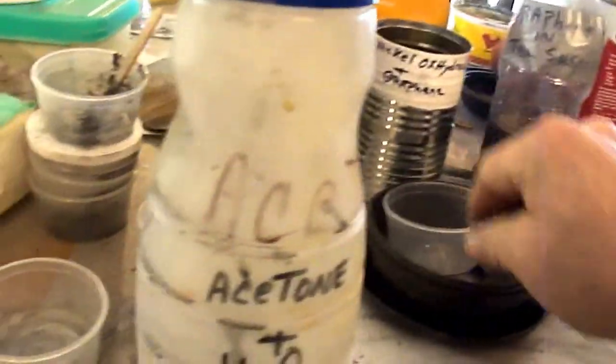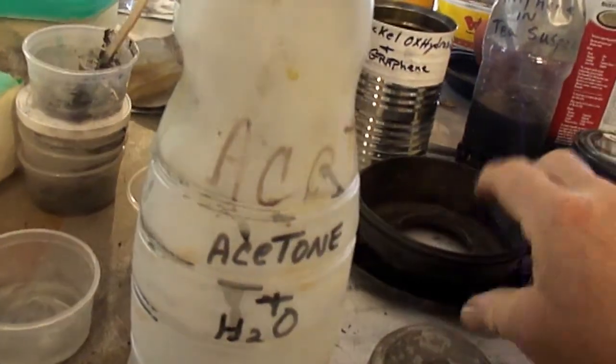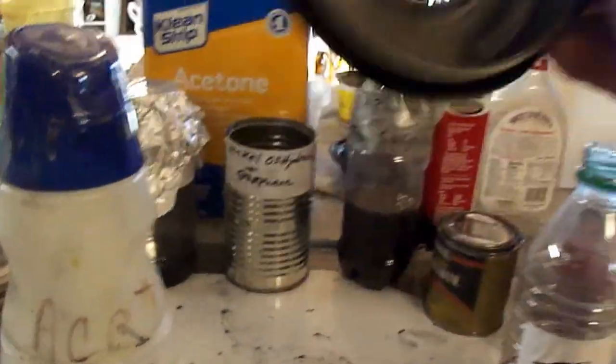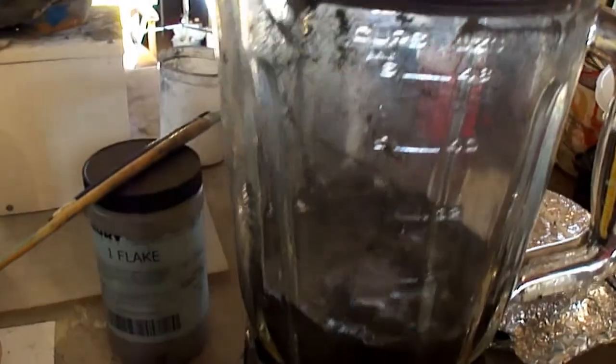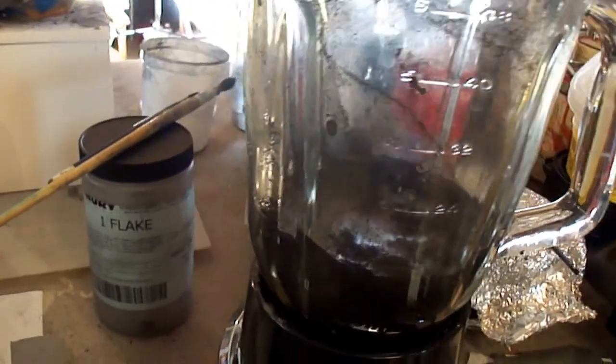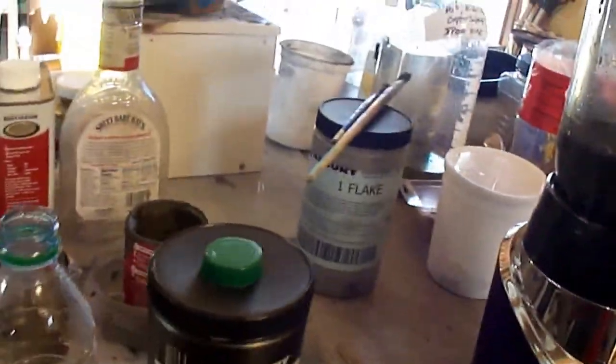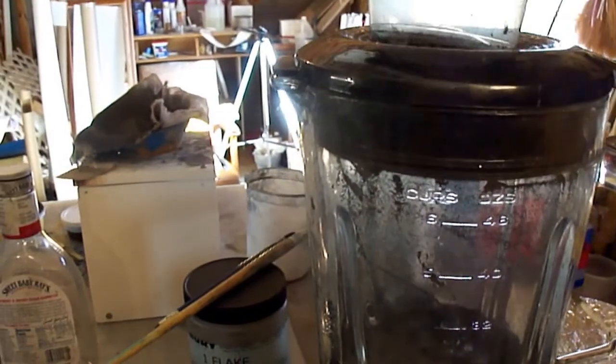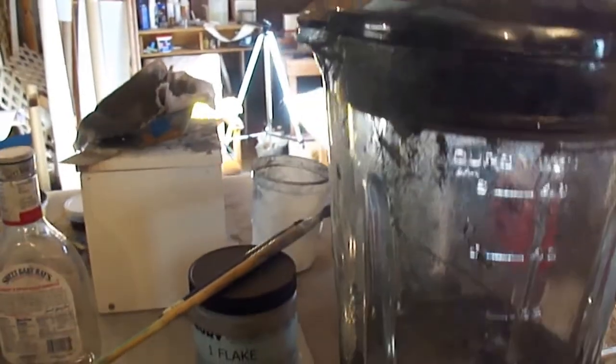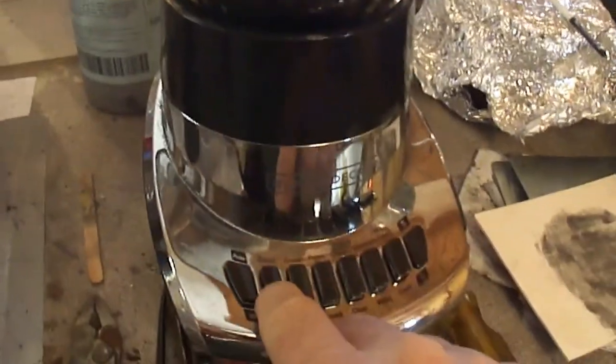And we'll clamp it off and start it up on a slow blend.